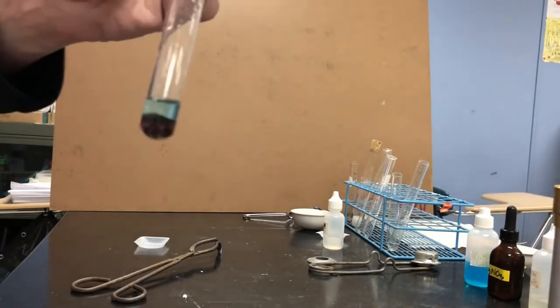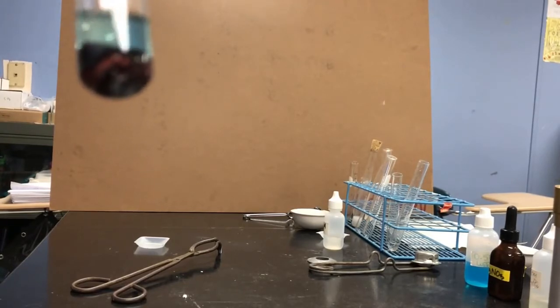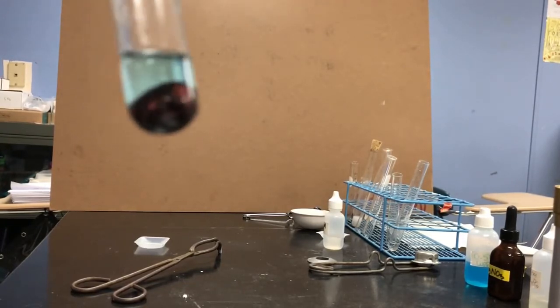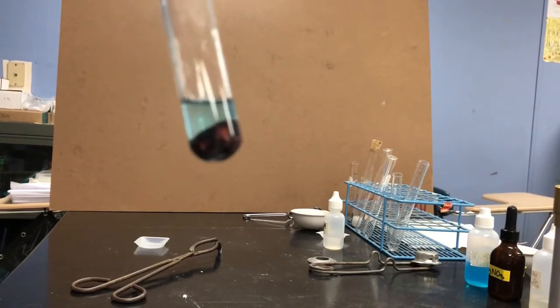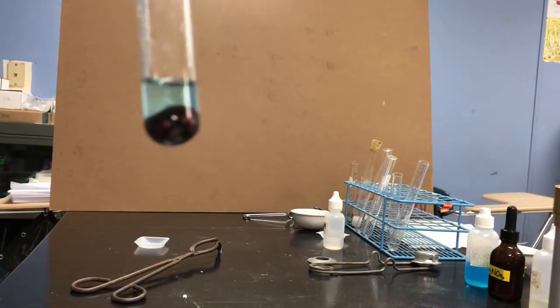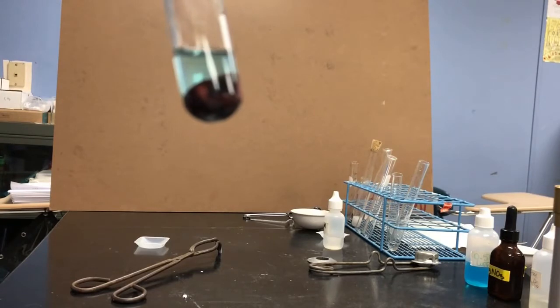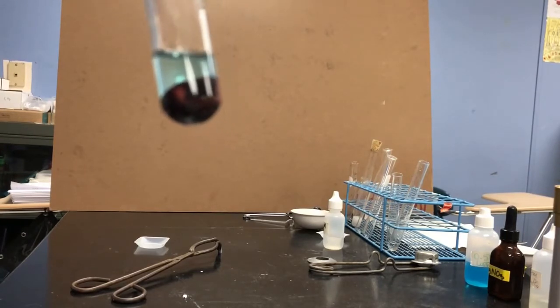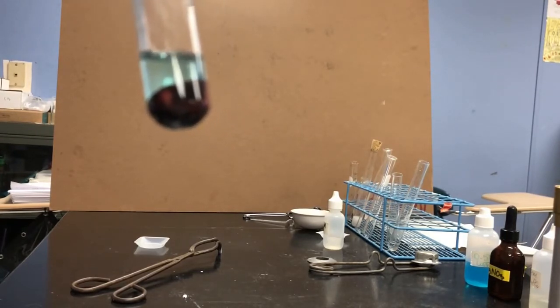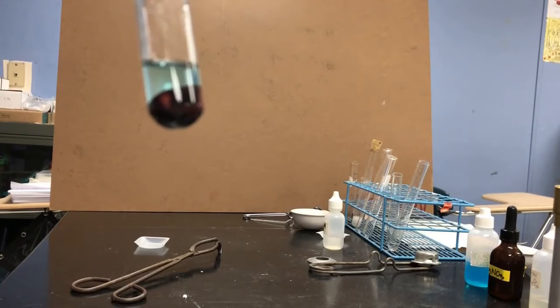We're back to reaction 4. We've done a few experiments now, and you can see we started with a metal that looked like silver. It was shiny and that kind of gray color. This is clearly not shiny and gray colored anymore. Also, the liquid we started off with was a really beautiful, intense blue turquoisey color. And that turquoise color seems to be not so turquoisey anymore.